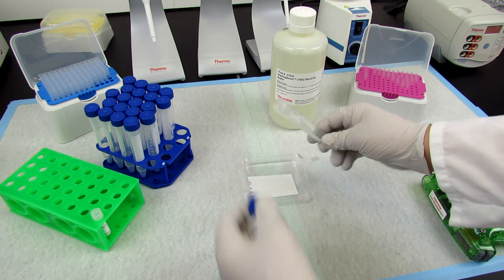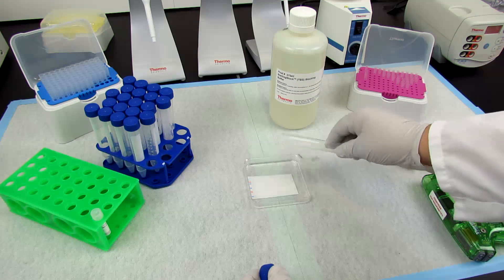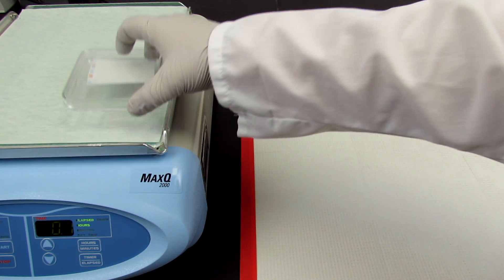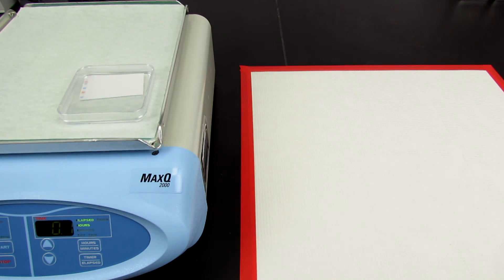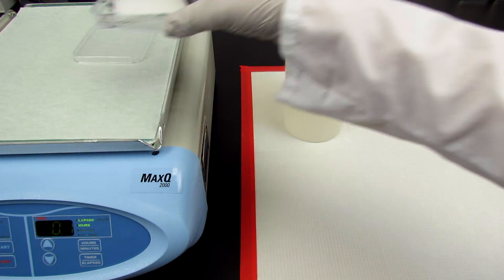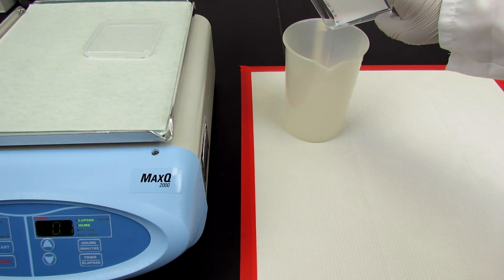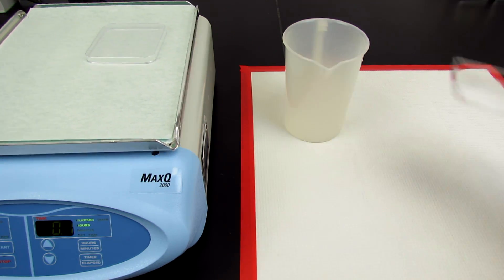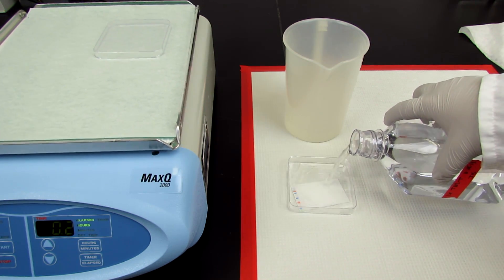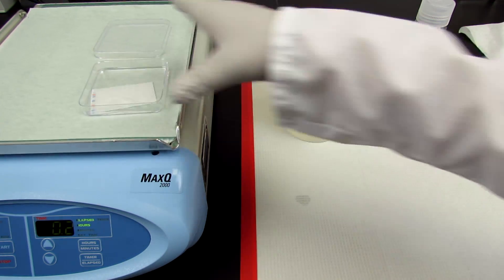After preparing the primary antibody solution, add it to the blocked membrane and incubate with shaking for one hour at room temperature or overnight in a cold room. Remove the primary antibody and wash the membrane three times with wash buffer to ensure there is no residual unbound or non-specifically bound primary antibody.